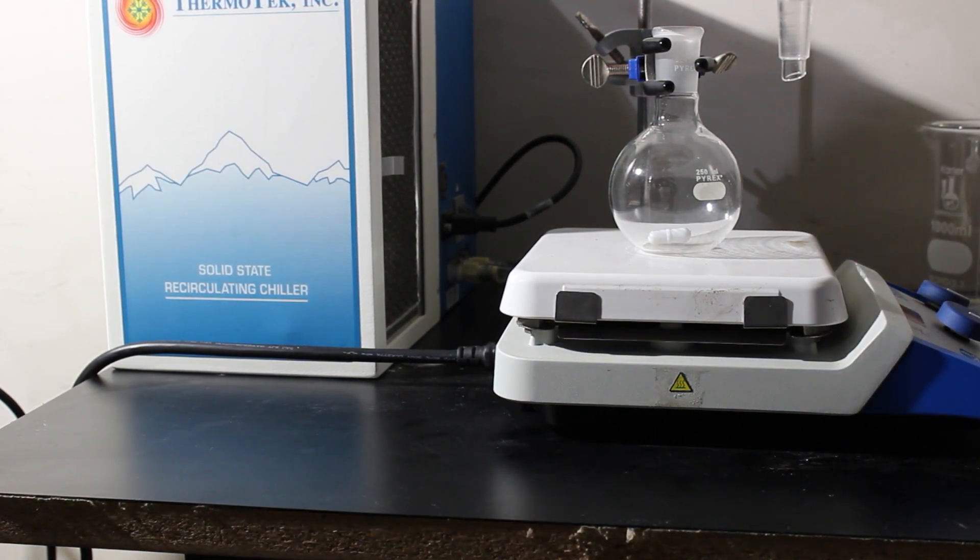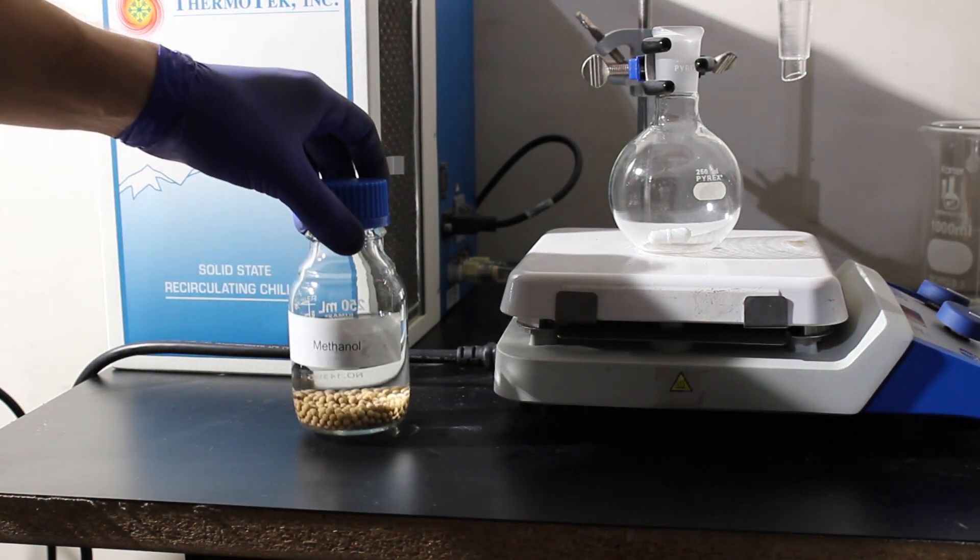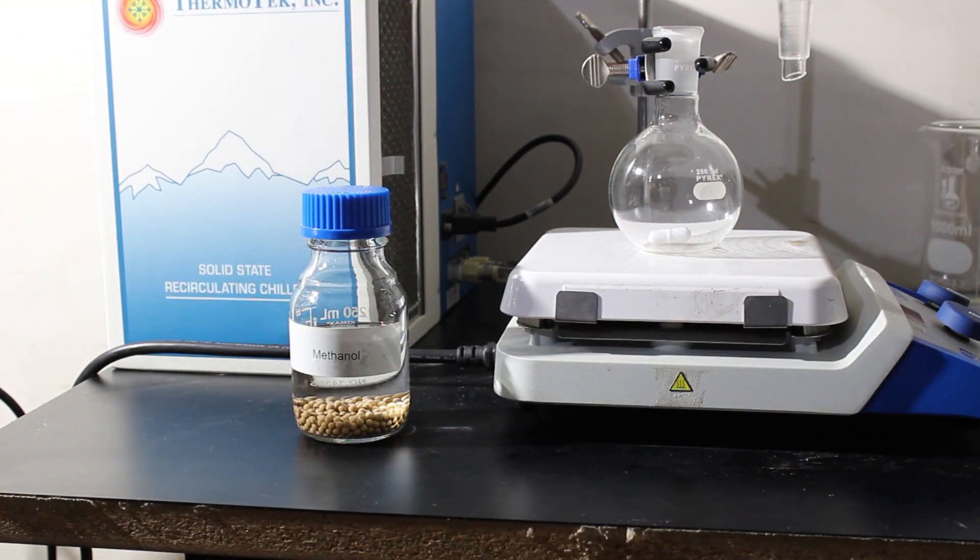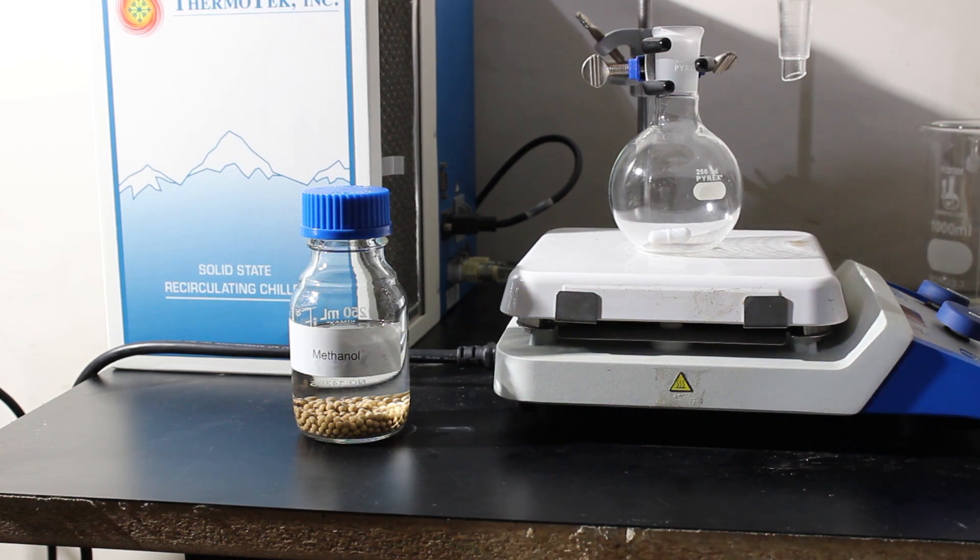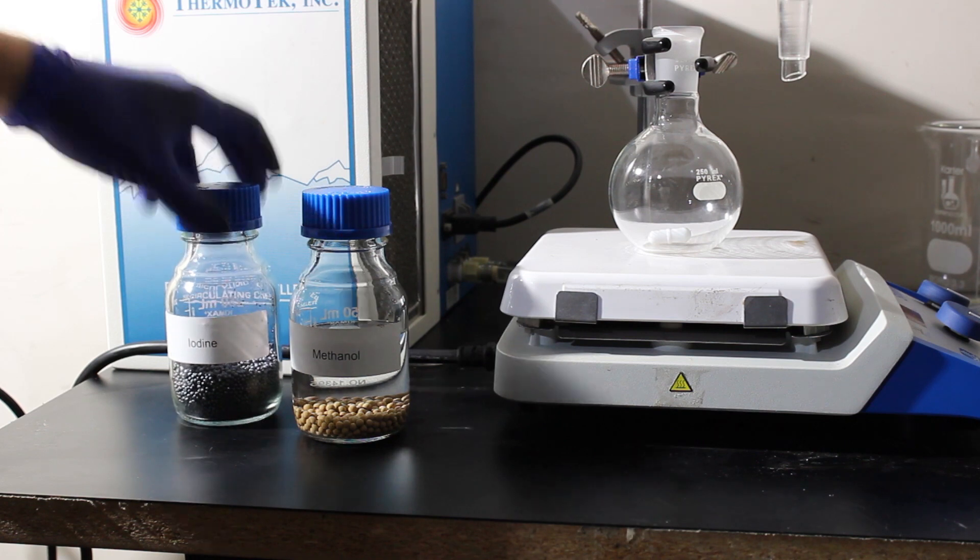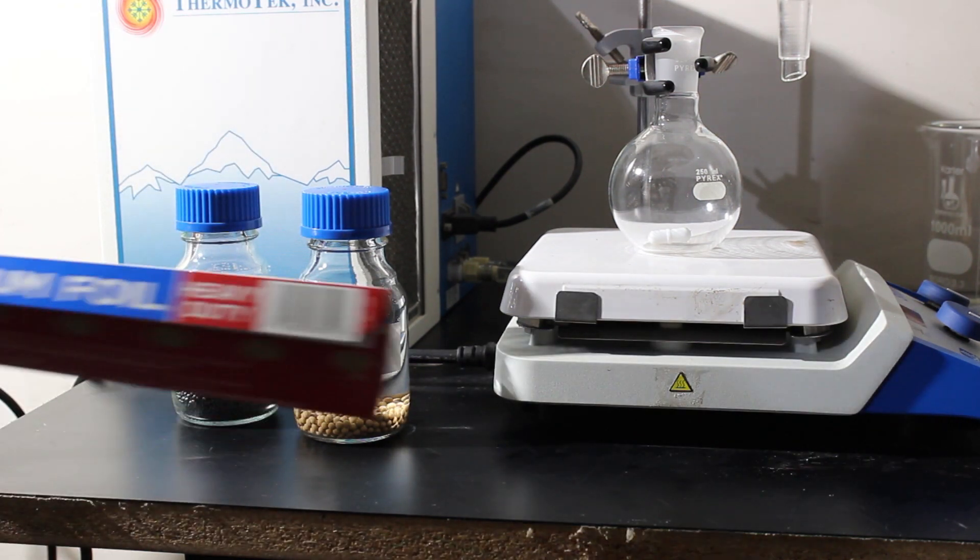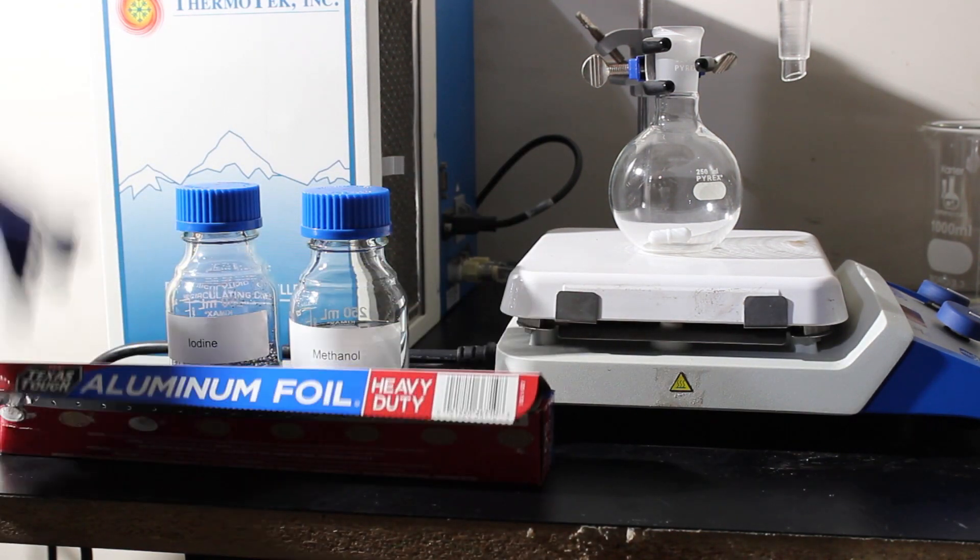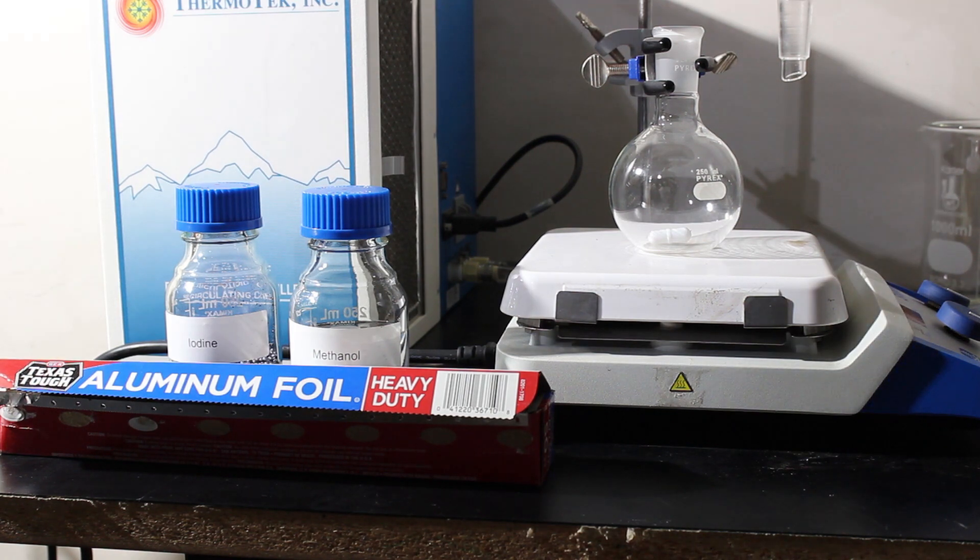Okay, so I think today I finally have enough time to set up something I've been thinking about for a long time. We'll be needing some dry methanol, some iodine, and some aluminum foil. We're going to attempt to make some methyl iodide.